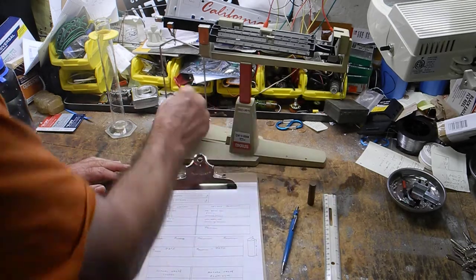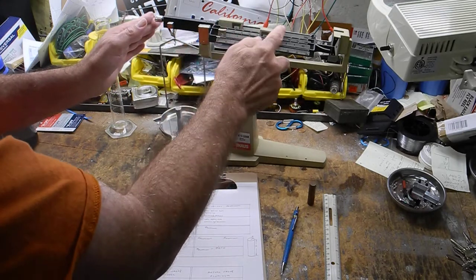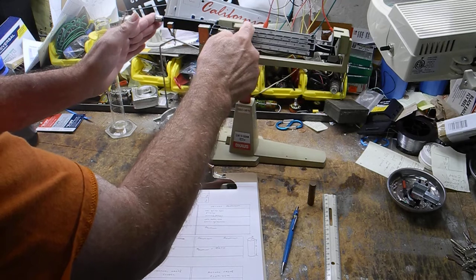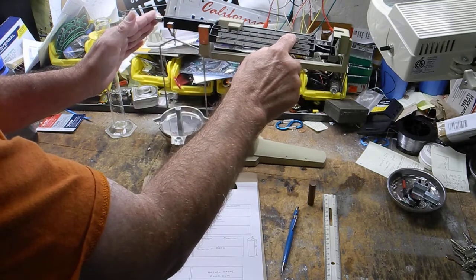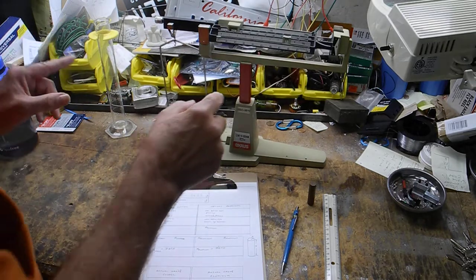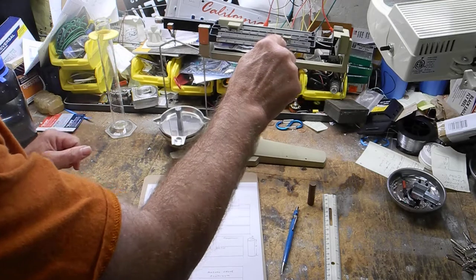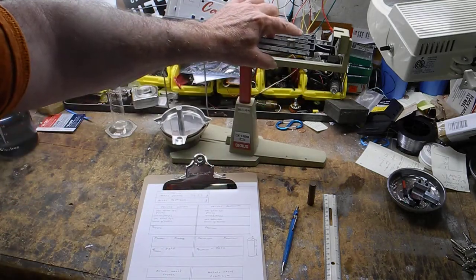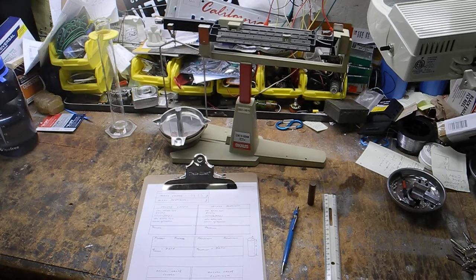We'll put the aluminum on there. You can see it's much lighter. It doesn't even trigger this thing. So we'll reset this and just move this until it starts. It's pretty close. Notice how it clicks. In order to get a proper mass, you have to be able to see the number in the window. See how that says 8 right there? If you're kind of in between like that, that's nothing. You can't have that.